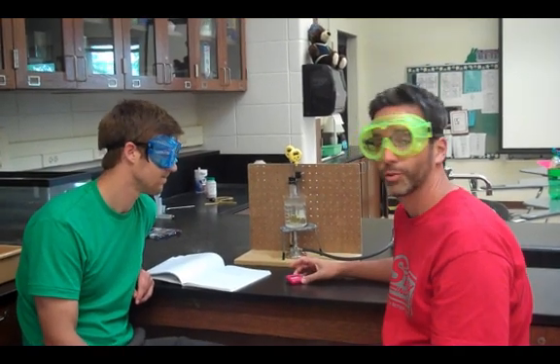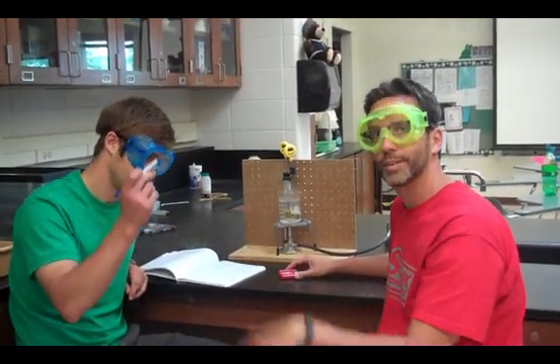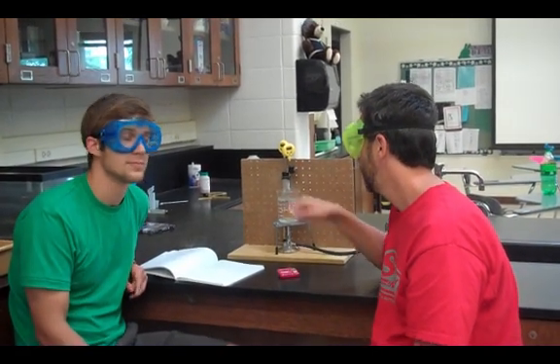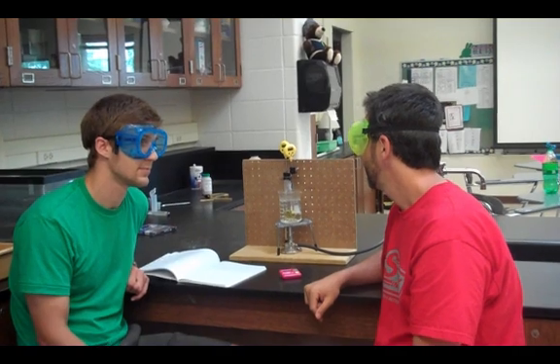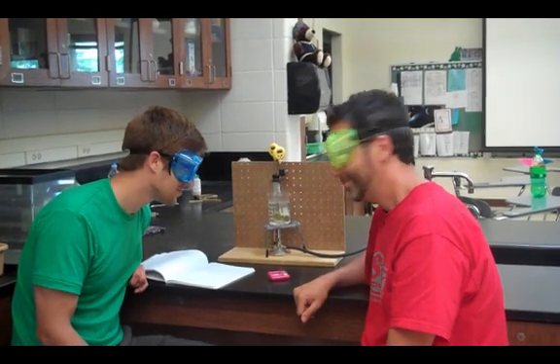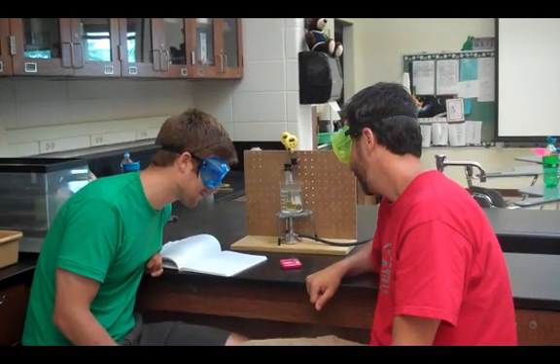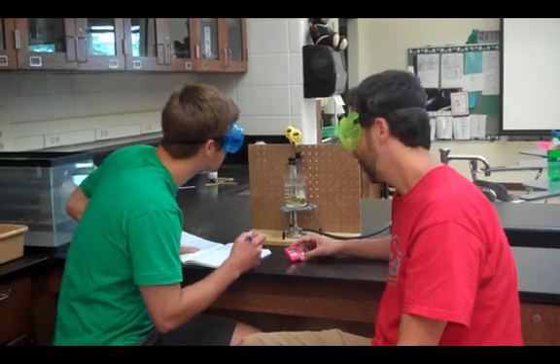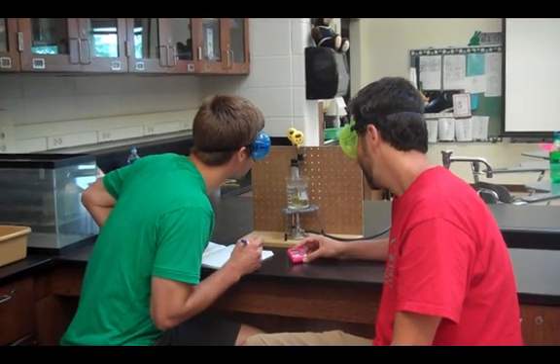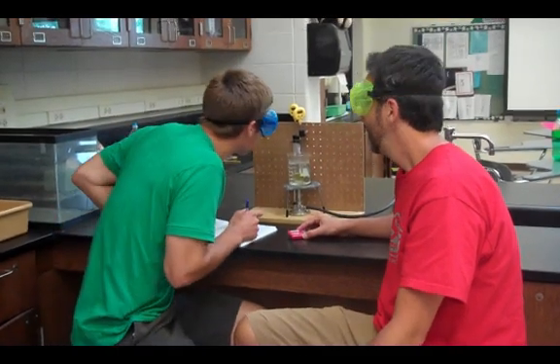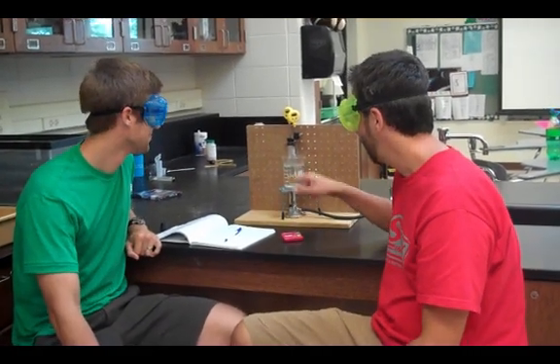And now we're going to take the temperature every 30 seconds. So in 30 seconds I will say time, and Mr. Smyne will write down the temperature of both the liquid water and the liquid unknown substance. That will be in 16 seconds. Not yet. Get ready. This is the exciting part. Time. And we'll do it again in another 30 seconds until your unknown substance is completely frozen solid.